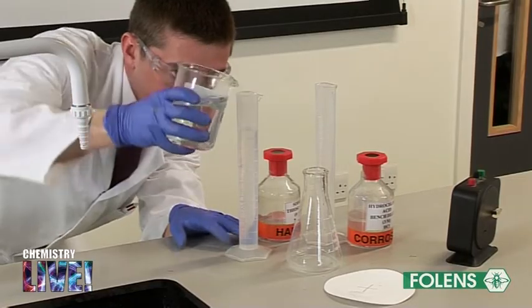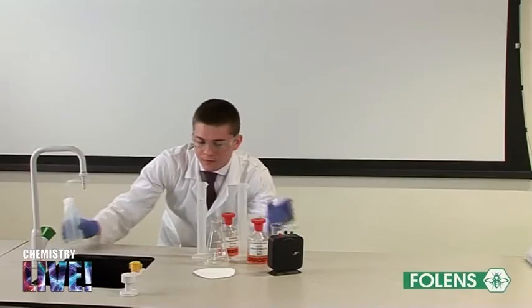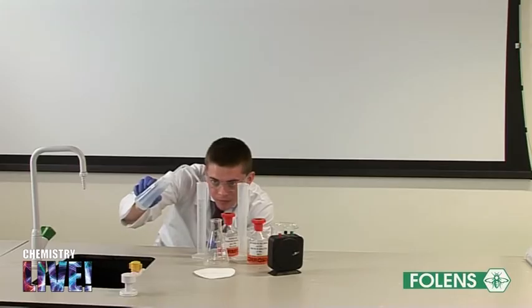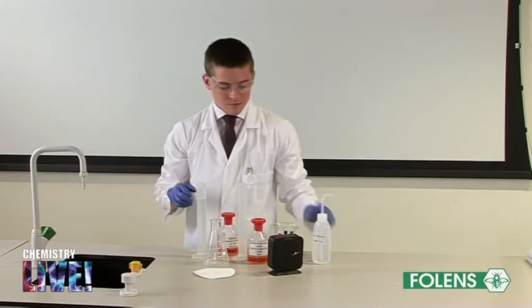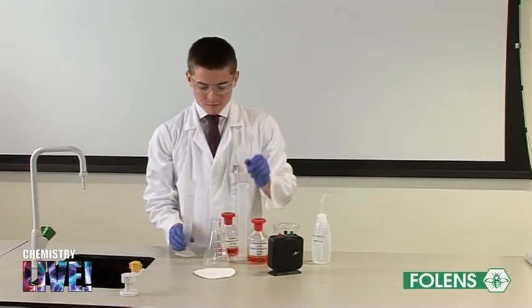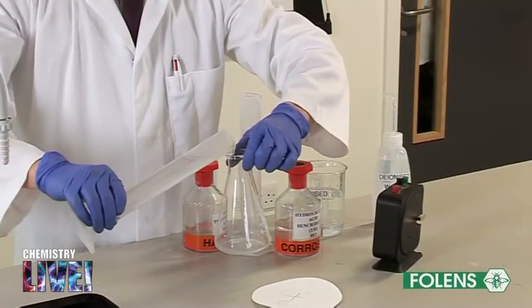This gives us a solution of concentration of 0.16 molar, that is 80% of 0.2 molar. Pour this solution into the conical flask.